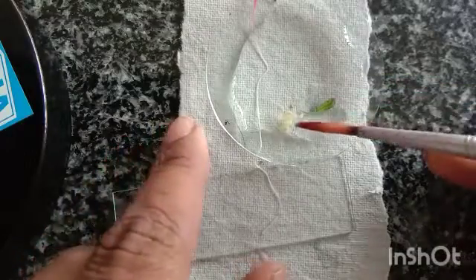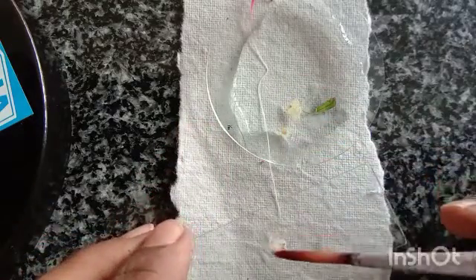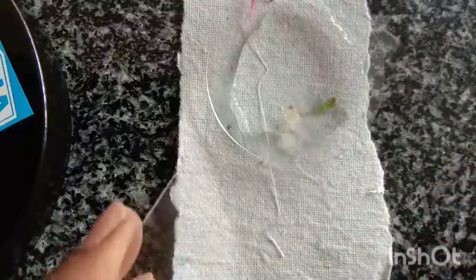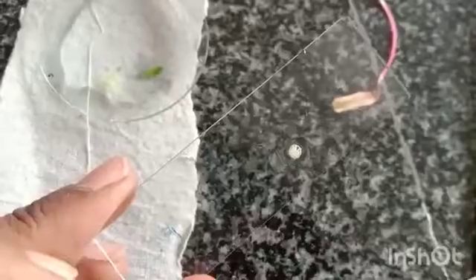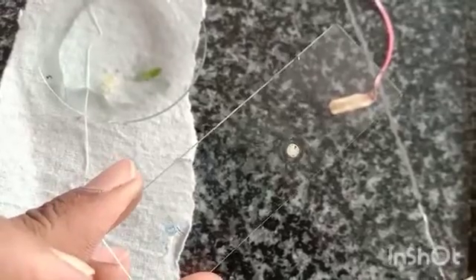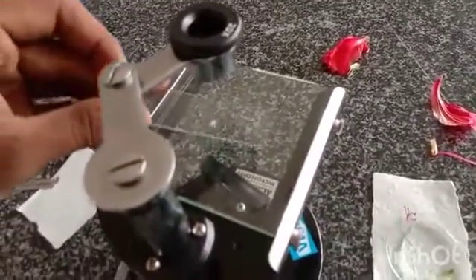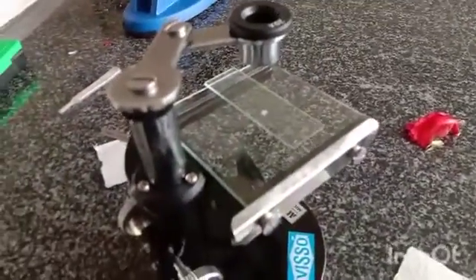Take a clean glass slide and select a thin section of the ovary. Can you see the transverse section of ovary? See here. Watch it under a dissecting microscope. You can see the locules and the placentation, which is the arrangement of ovules inside the ovary.